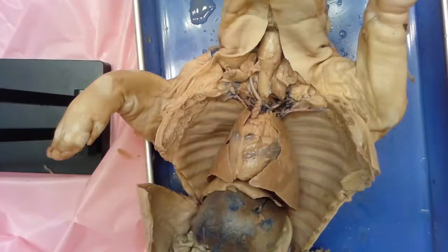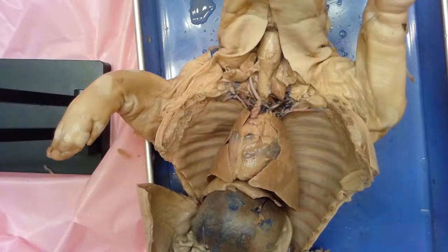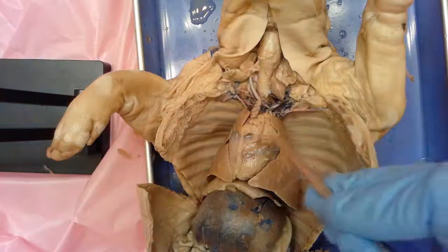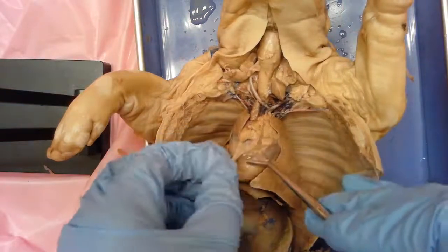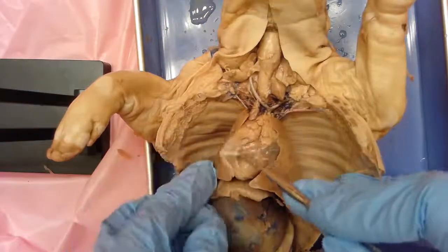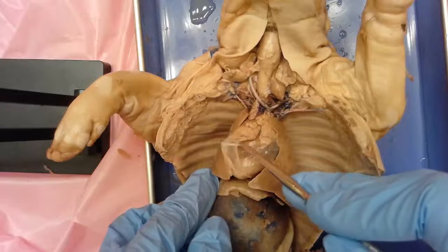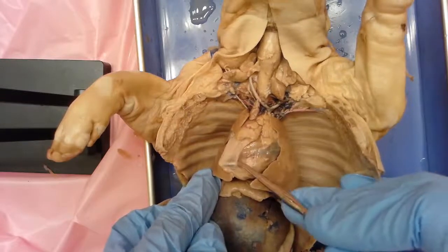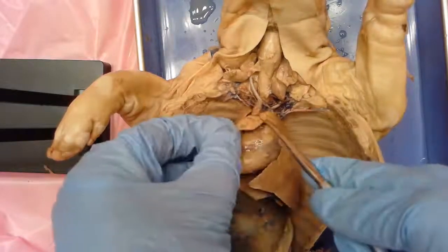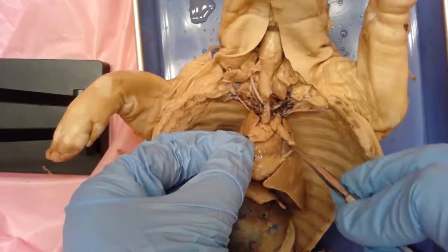We are looking at the circulatory system, and I mentioned earlier that this was the heart. One of the structures surrounding the heart is this clear membrane here, and this is the pericardium. The pericardium surrounds the heart to protect it, and there's actually fluid that's in there.